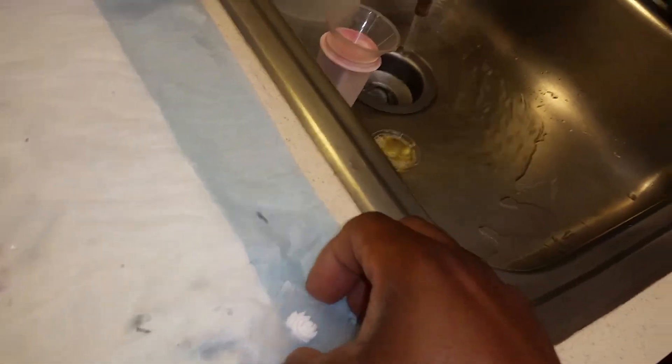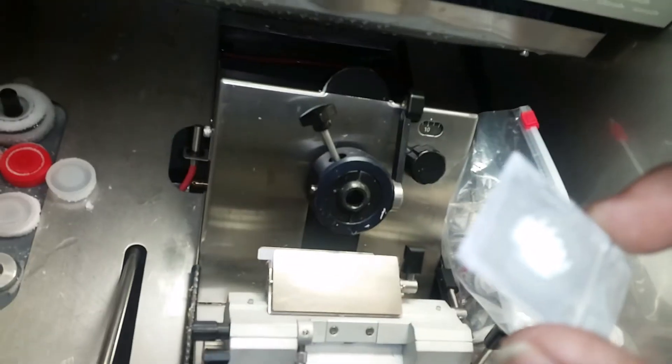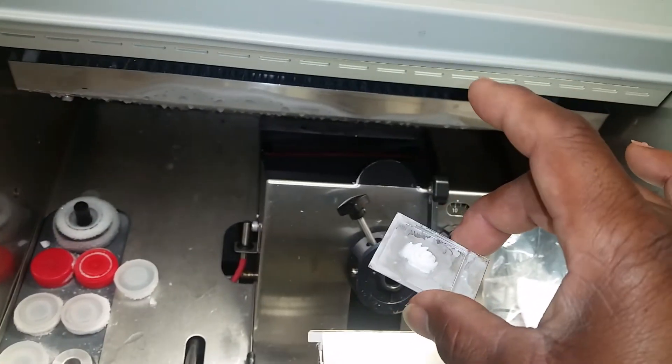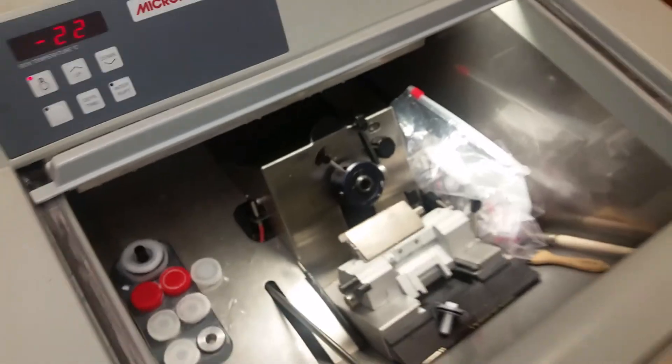Cool off and ready to go. There's no specimen inside this block — I'm just showing you how I attach and detach it for cryotomy in the cryostat, and for detaching it for storage for later. Anyway, this is Nick Hinton signing out — hope I helped someone.